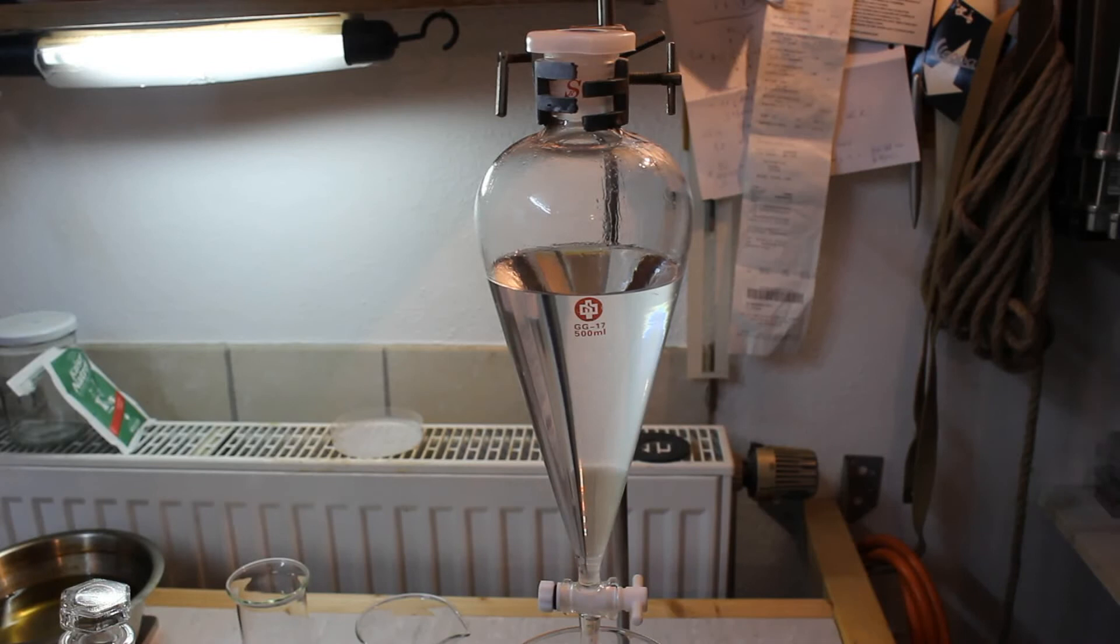Off camera I washed the ether with saturated baking soda solution a second time and now we're going to wash it with a saturated table salt or sodium chloride solution one last time.